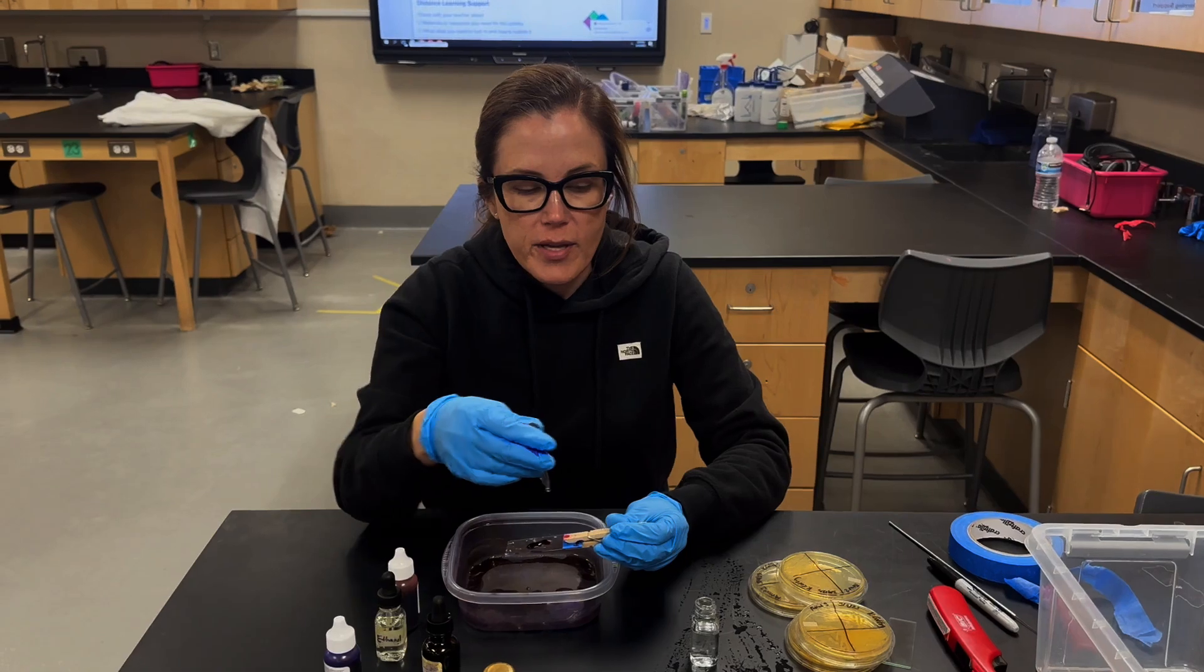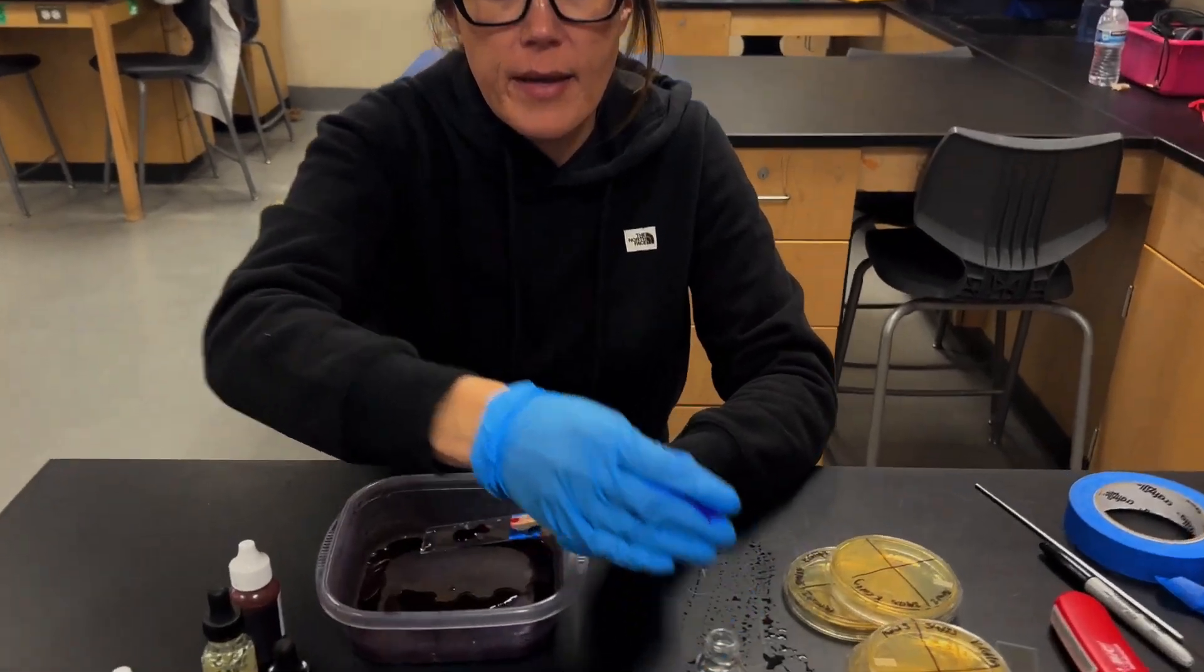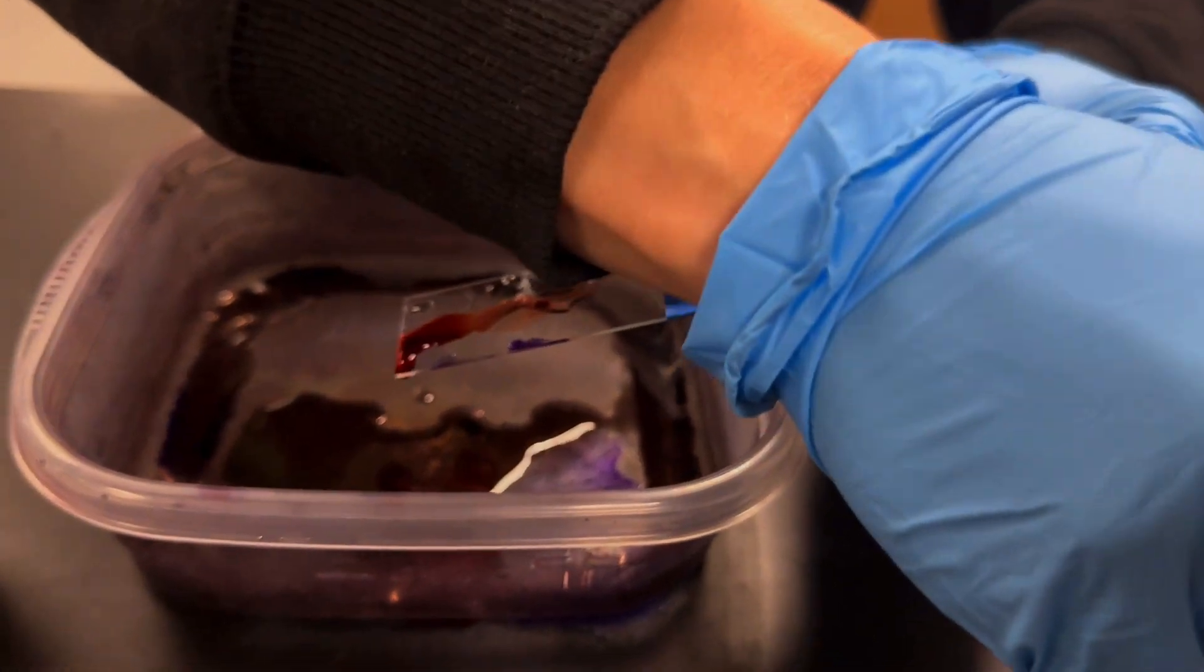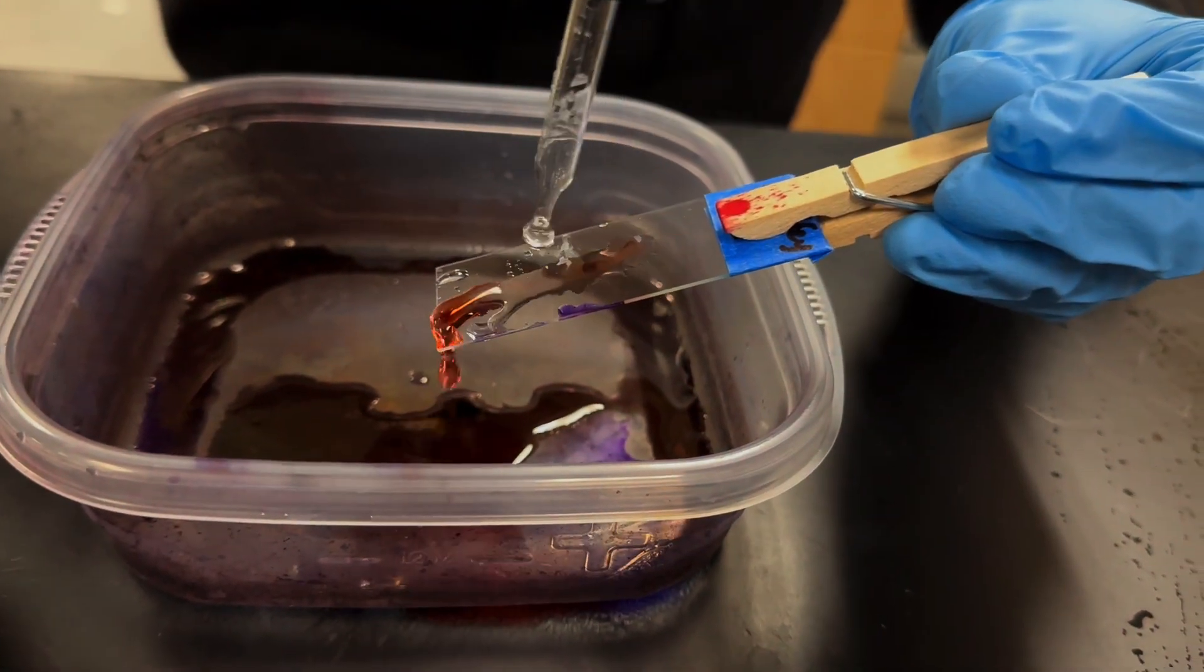After one minute, you can rinse the slide with water. So again, we'll just run it over the sample until most of the color is off.